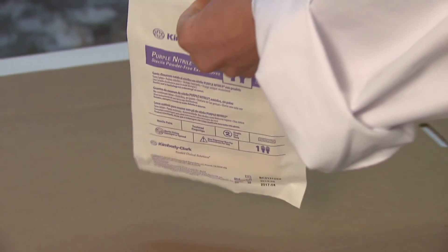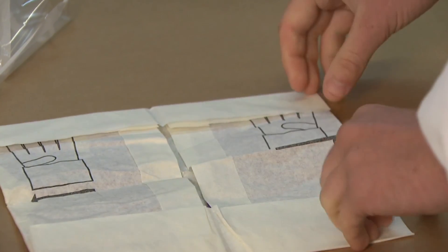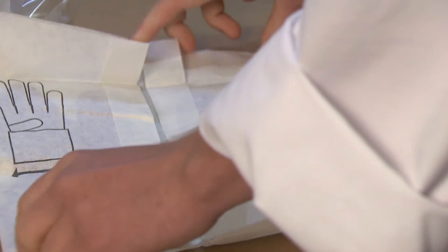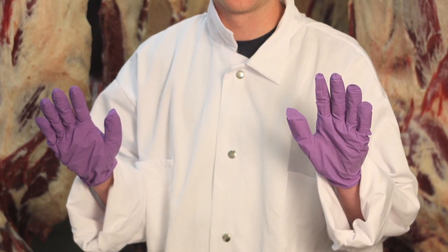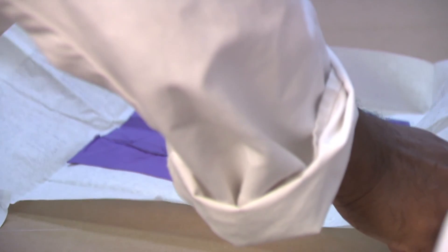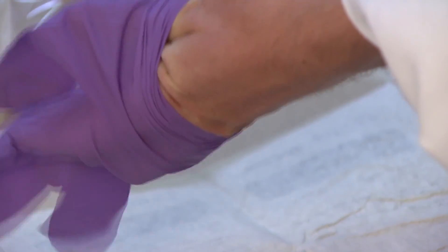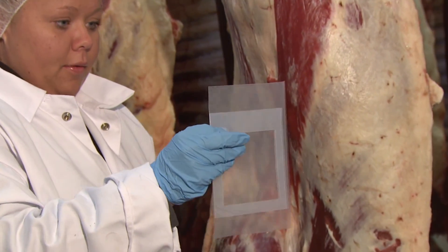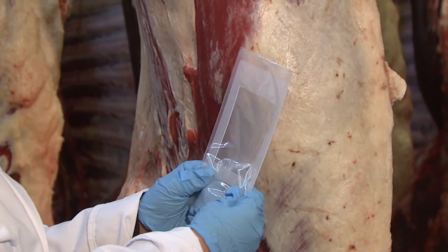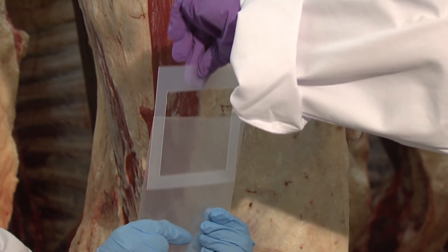The person conducting the sampling will need to wear sterile gloves and follow aseptic procedures to avoid cross-contamination. It's important not to contaminate the sterile gloves, the sampling template, or the sponge by touching any non-sterile items or surfaces. An assistant can open the glove bag and unfold the wrapper. The person sampling puts on the right glove touching only the cuffed area, then the left glove, making sure not to touch the cuffed area with the sterile right glove. Next, the assistant works the sampling template to the top of its bag without touching it, and the sampler carefully removes the template without touching the outside of the bag with sterile gloves.